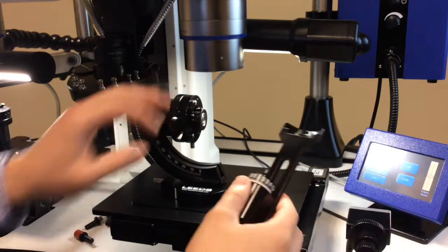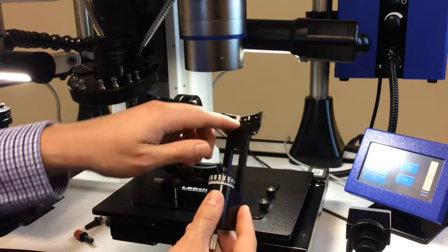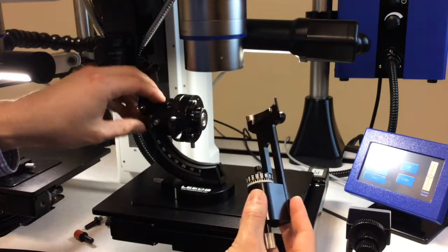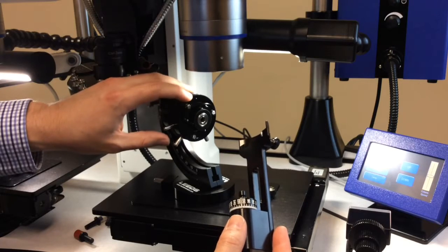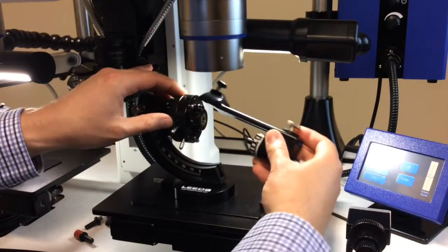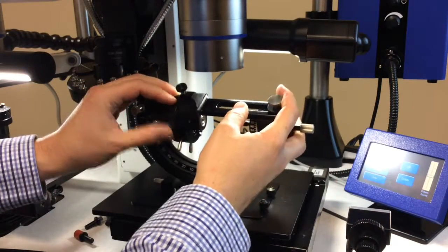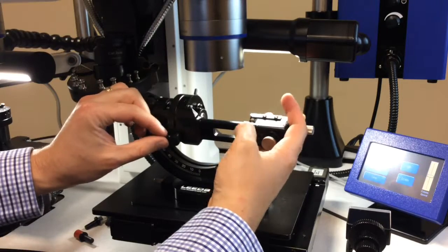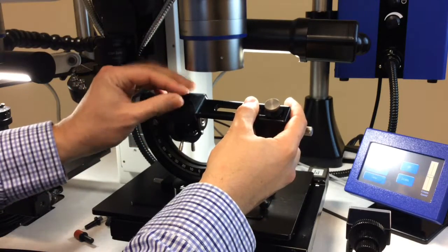Once we do that, we're going to take our on-center portion, look for this pin, and then look for the corresponding hole on the universal holder. Once this is in place, it's a spring-mounted screw, so I'm going to press down and tighten.